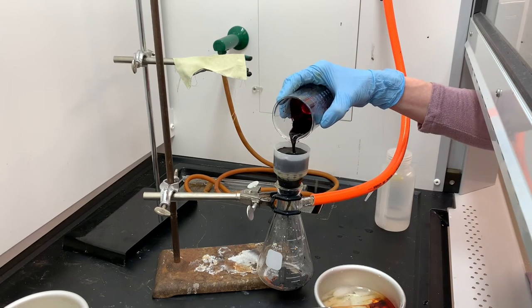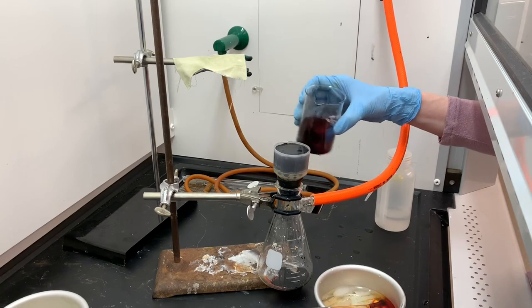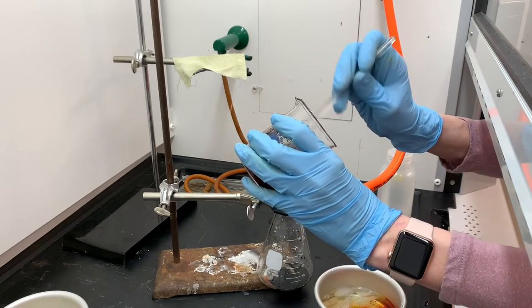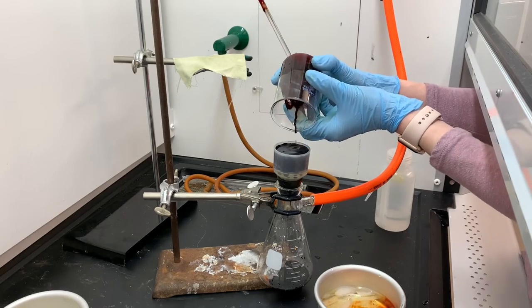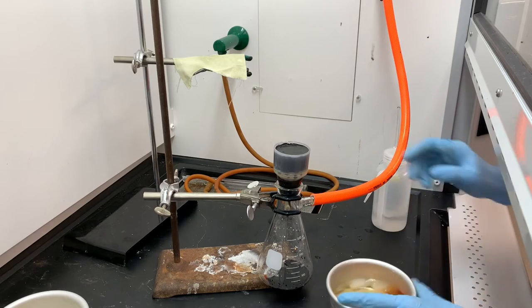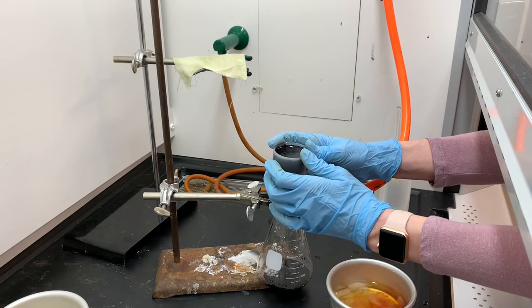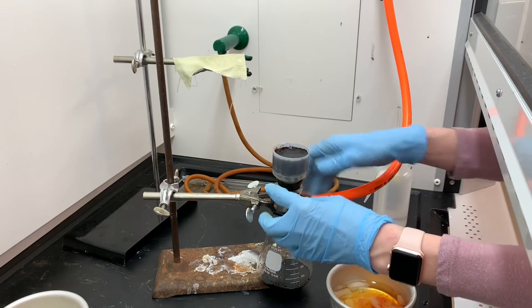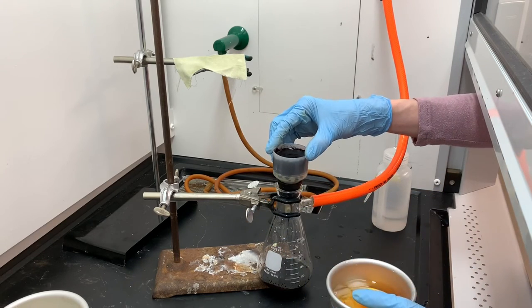The azo dye is a really fine powder, which makes it pretty difficult to filter via vacuum. The small particles kind of clog up the filter paper — not literally, but they make it harder for the water to pass through. This is going to have to sit on vacuum for quite a bit longer than normal — it's just a slow vacuuming process. I'm pushing down on the vacuum to make sure I have a really good seal, which helps speed up the process, but in general we just have to be patient and wait for all that water to get sucked through the filter paper.